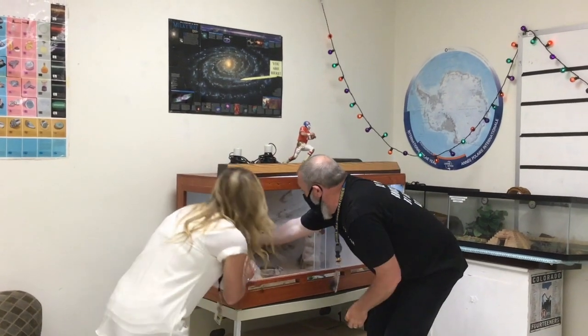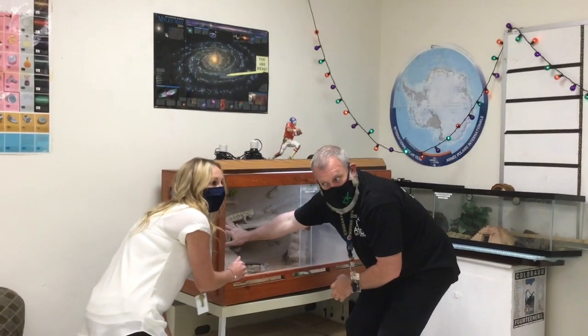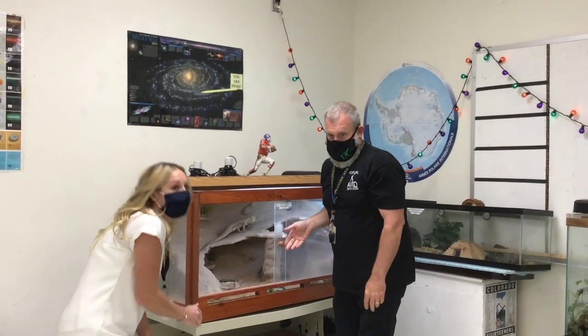Hey! You shouldn't be opening those animal cages without permission! Sorry. Sorry.